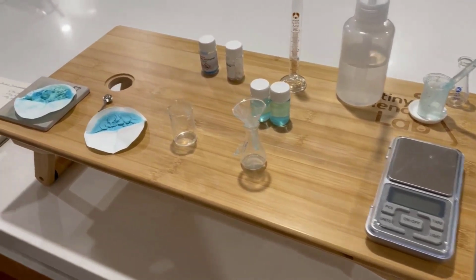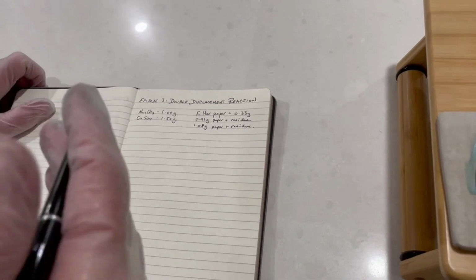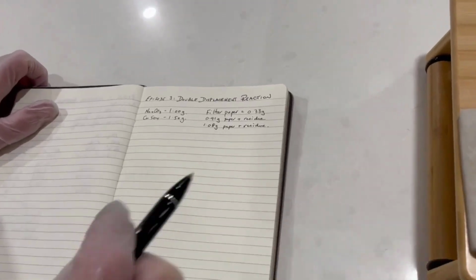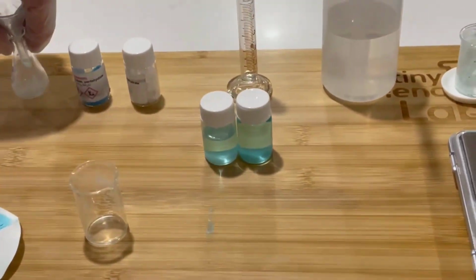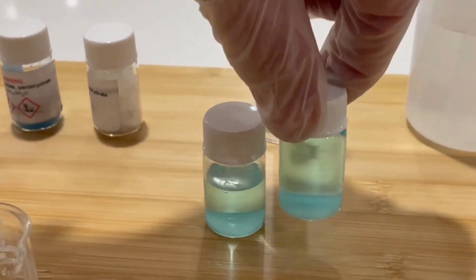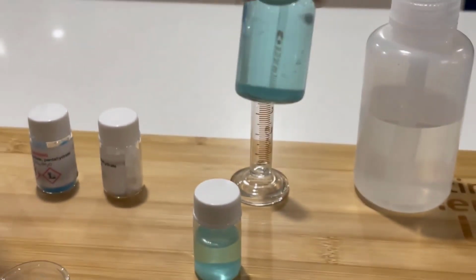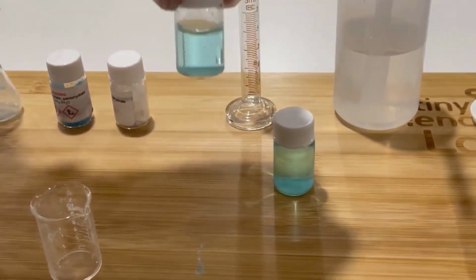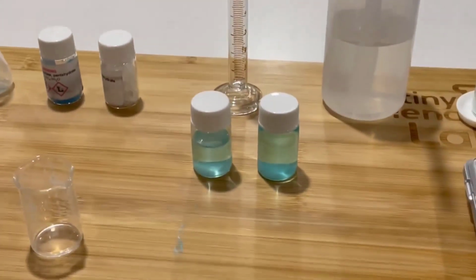So that means if I subtract the filter paper, we've obviously had to go to a second filter paper. The first one was just getting too clogged with the residue, so I had to switch it over. The other thing that you will notice is that we did collect the filtrate. The filtrate's had a little bit of time to settle now, and you can see there's a slight blue coloring in there, and there's actually a little bit of precipitate still down the bottom. So some of it's actually gone through the filter paper and it's caught in the bottom.